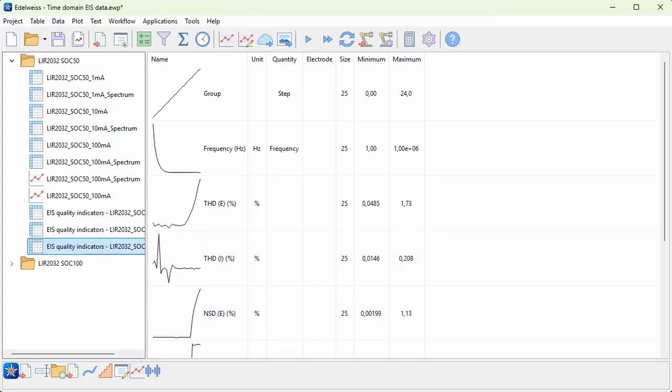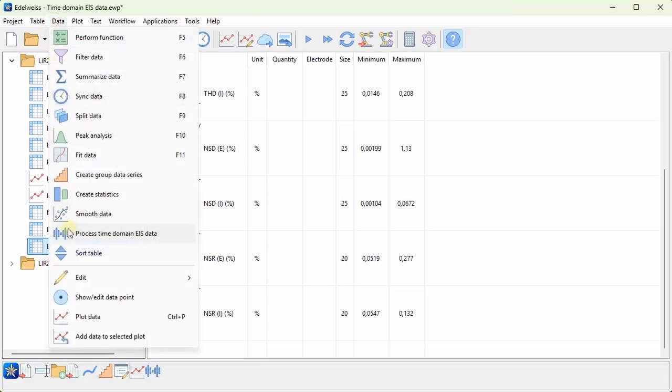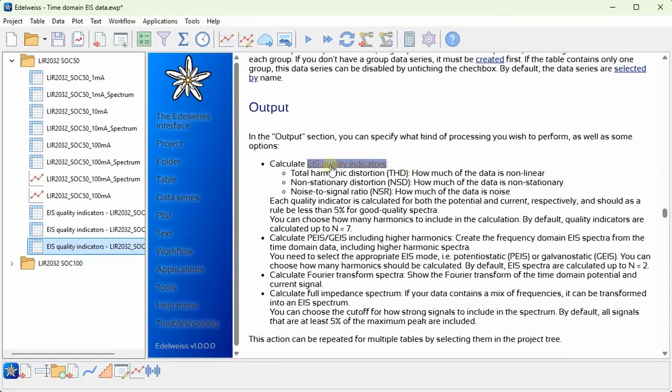This contains the calculated quality indicators. It's too much for this video to go through exactly what these quality indicators mean, but you have the THD or total harmonic distortion, the NSD or non-stationary distortion, and then the NSR or noise to signal ratio. And if you want to know more, I can recommend going to the help pages, for example by selecting what's this and then process time domain EIS data. And here you can see there's a link to more information about EIS quality indicators.